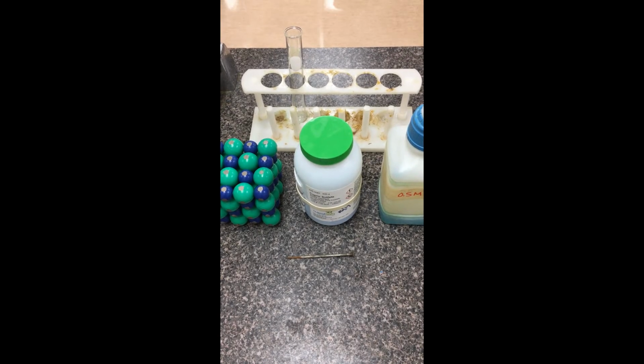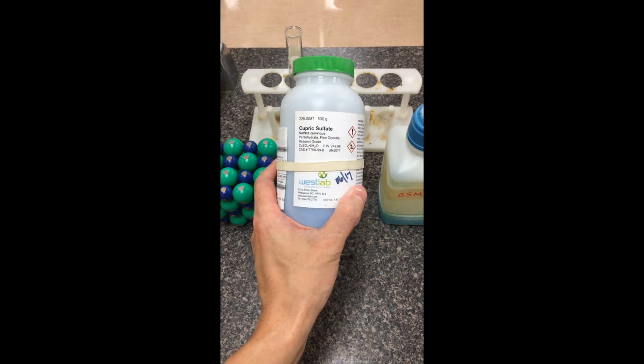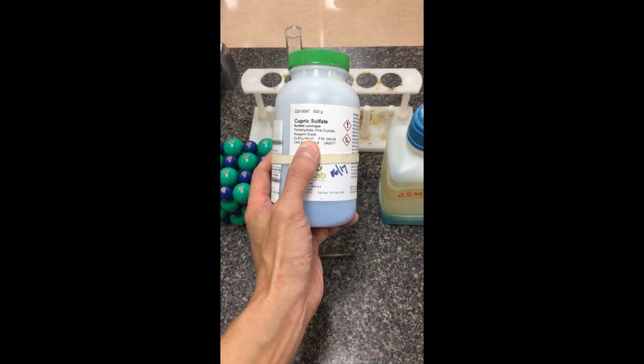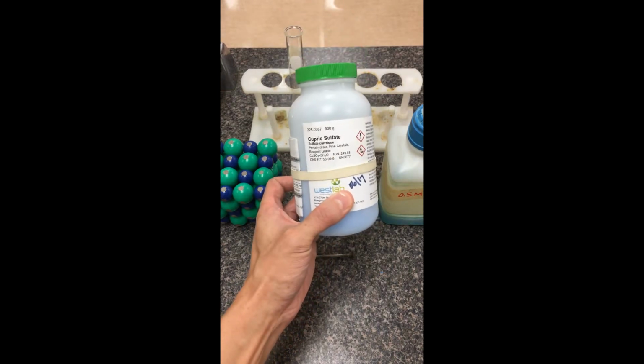All right, so we're going to continue with our reactions lab here. This is station number 2. What we started with here is this compound, cupric sulfate. You have the formula right there, CuSO4·5H2O. We remember that the 5 water represents that this is actually in the hydrate form. Notice that as a hydrate, this is a solid.